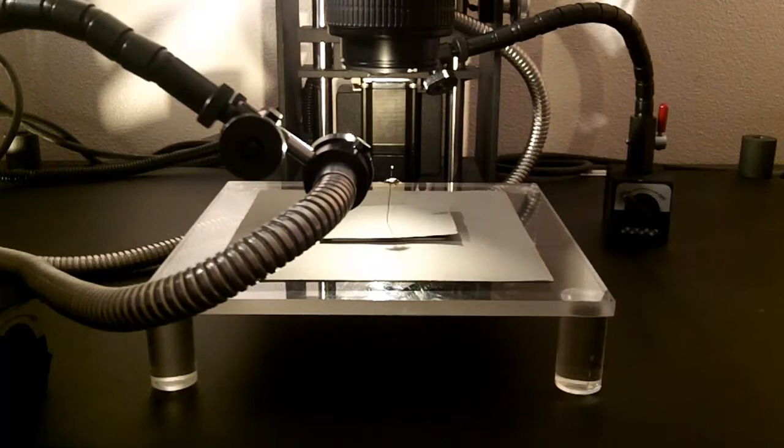If you just compare, as I zoom in where I did have the fiber optic cables on, there's a lot more detail highlighted on the back than the one without. You see the inside ridges a bit more highlighted. And here they're just dark lines. You can get an idea of the depth. So this is just a rough showing of what you can do with fiber optic cables.